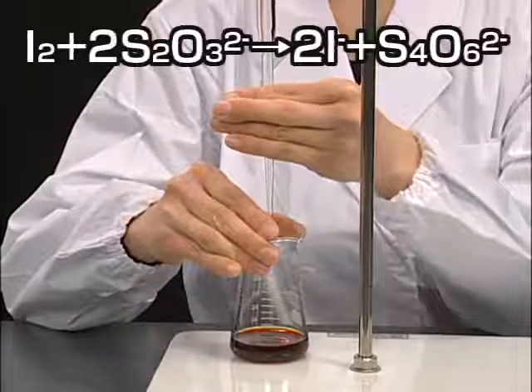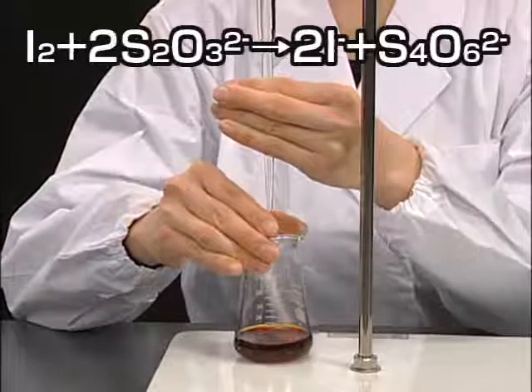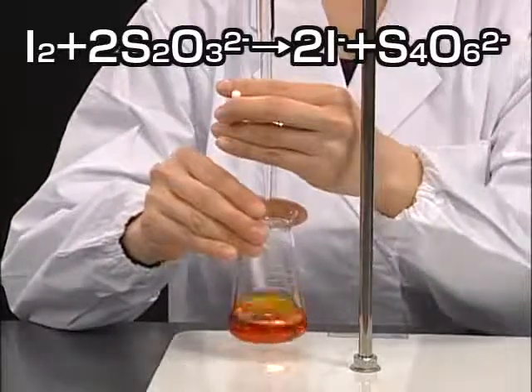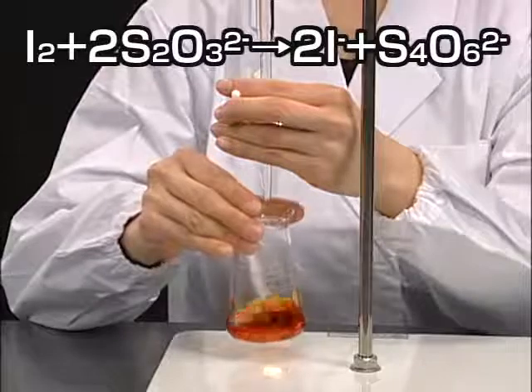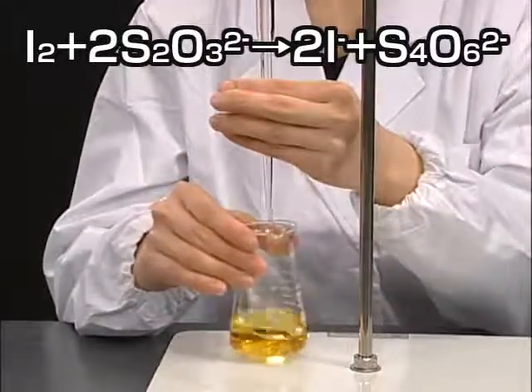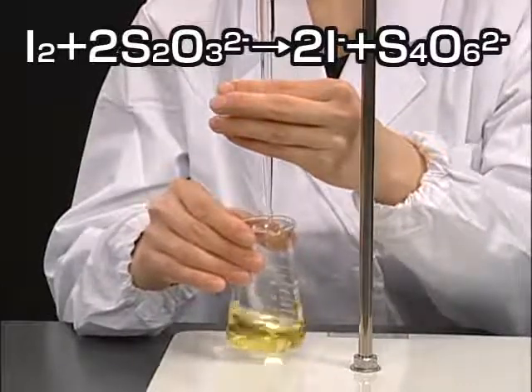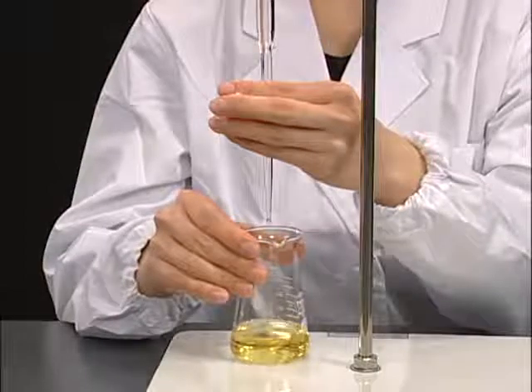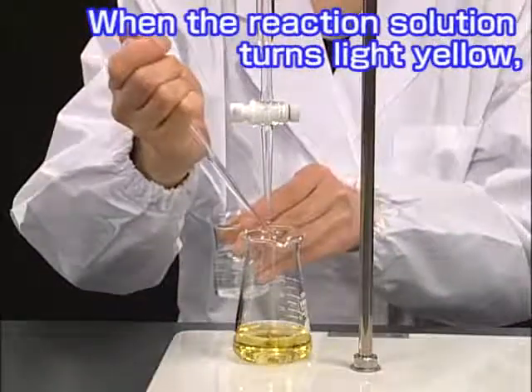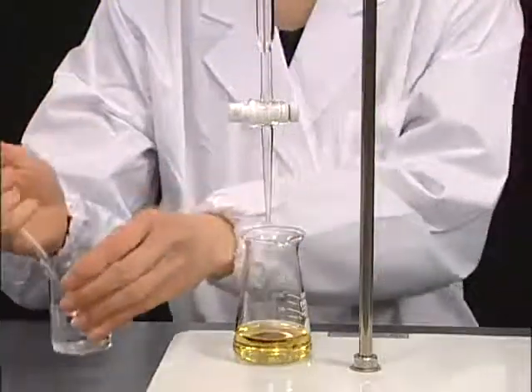Titrate the reaction solution with a solution of sodium thiosulfate whose concentration has been determined. When the reaction solution turns light yellow, add a few drops of starch solution to increase the sensitivity of titration.